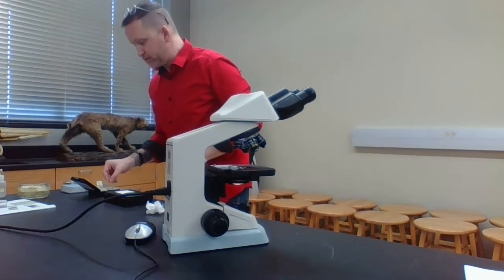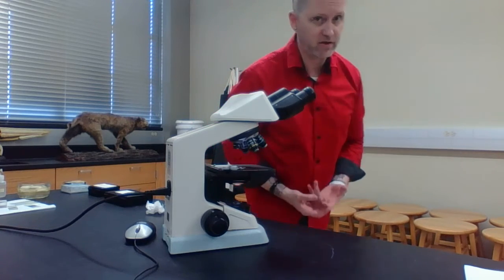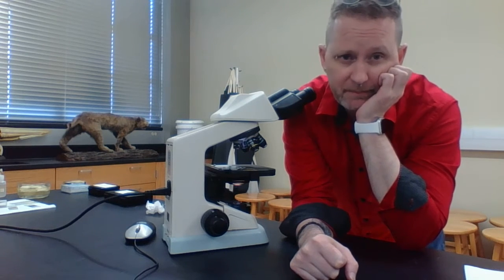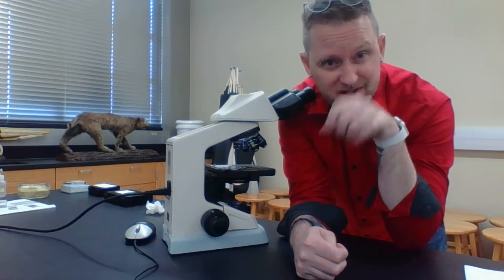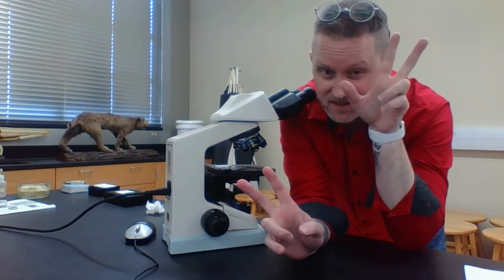Now, for the next two laboratory exercises, we're going to be making slides ourselves. Most of what you're going to see throughout the semester is preserved and stained. What does that mean? The specimen's killed, it has to be preserved, some of it has to be sliced, and then it has to be stained with specific dyes. Well, what we're going to be doing is looking at something that's sort of living, although it's going to be dead afterwards.